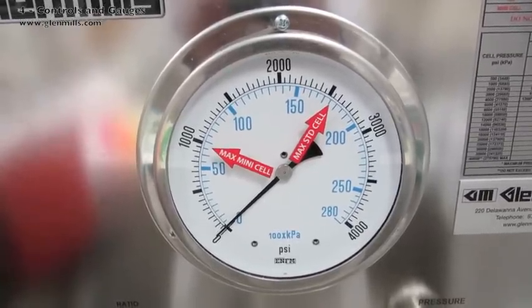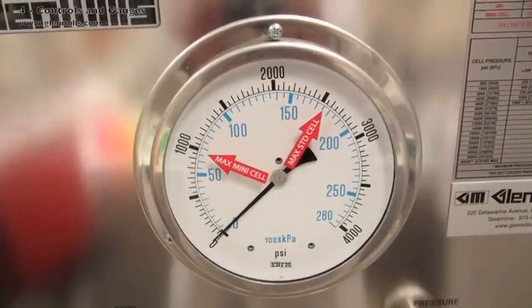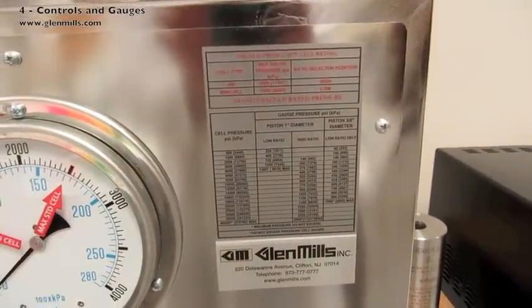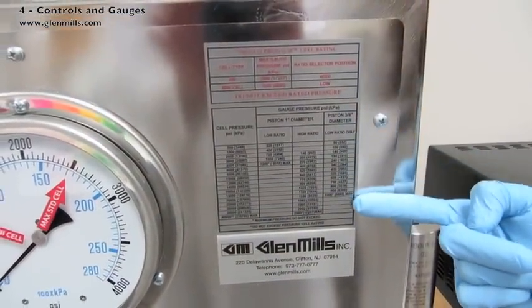For example, if it is set to 1500, times 16 equals 24,000 psi inside the cell body. There is also a conversion table that shows the pressure inside the standard pressure cell based on a reading off the pressure gauge.